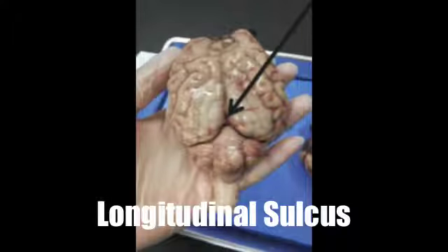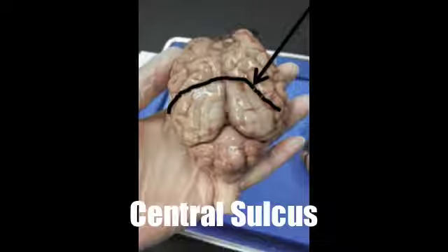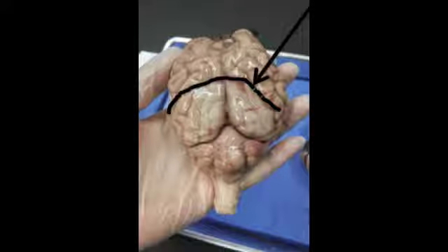The longitudinal sulcus marks the division between the left and right hemispheres of the brain. The central sulcus is a fold in the cerebral cortex in the brains of sheep that separates the parietal lobe from the frontal lobe and the primary motor cortex from the primary somatosensory cortex.